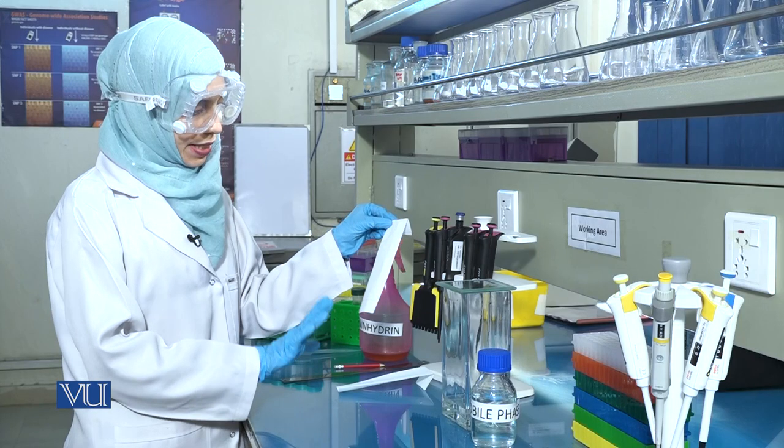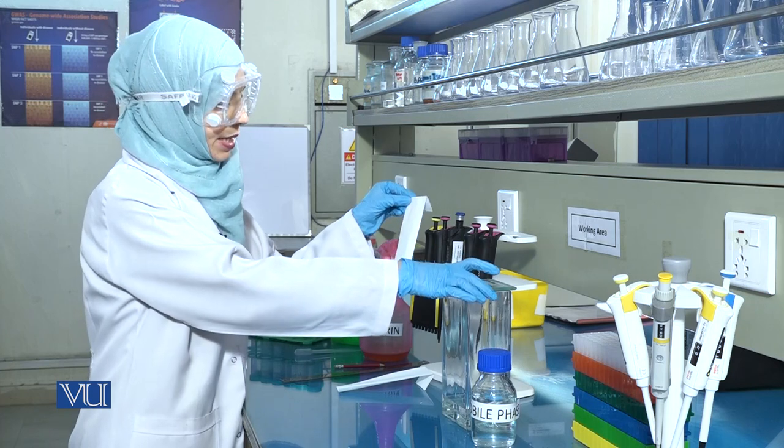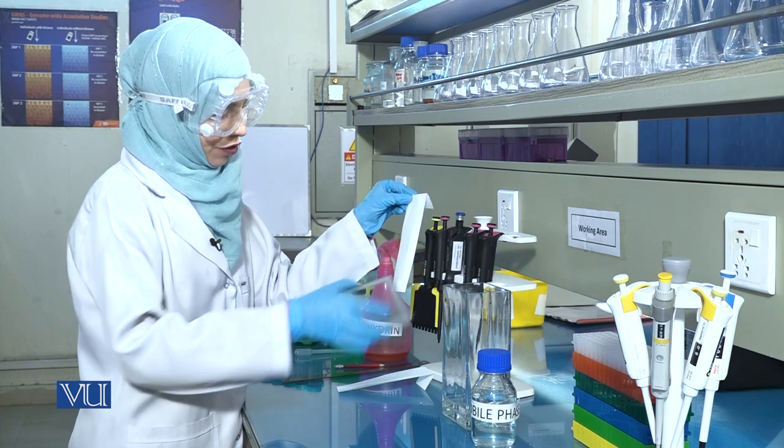Once the sample has dried completely, carefully place this filter paper in the chromatography tank.